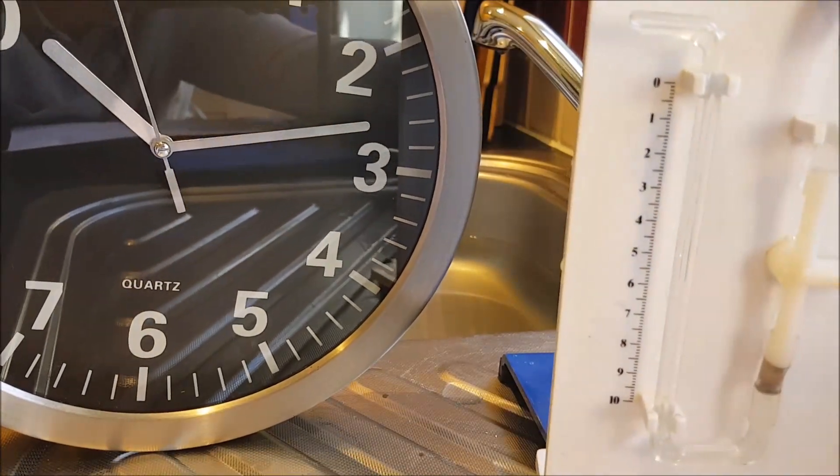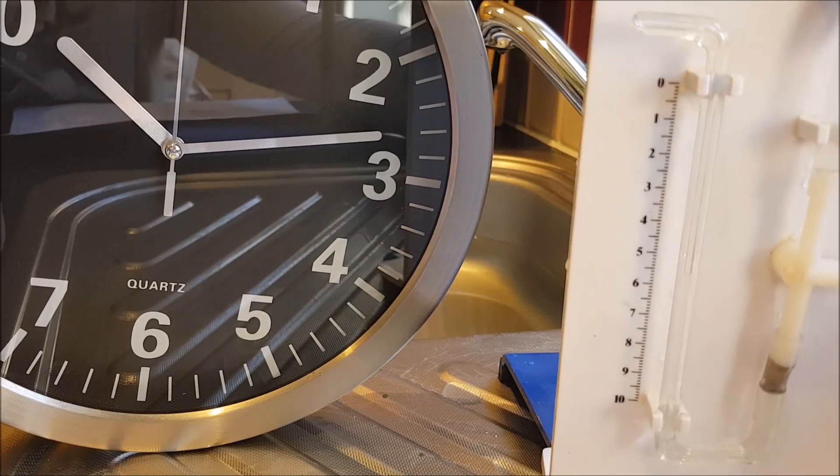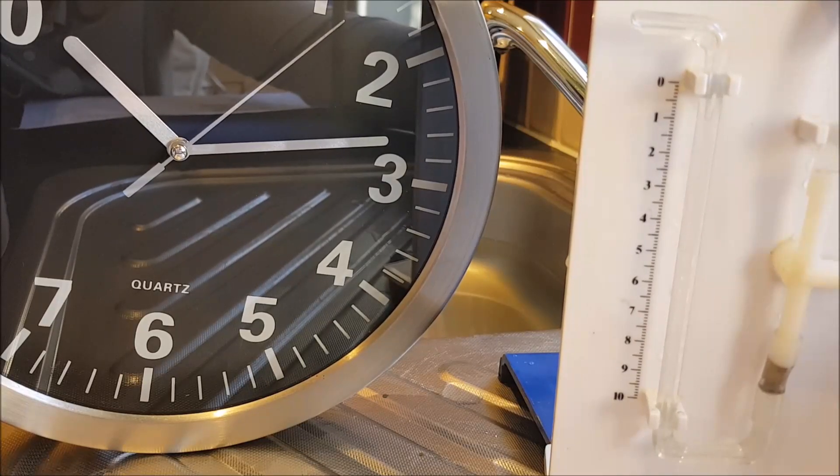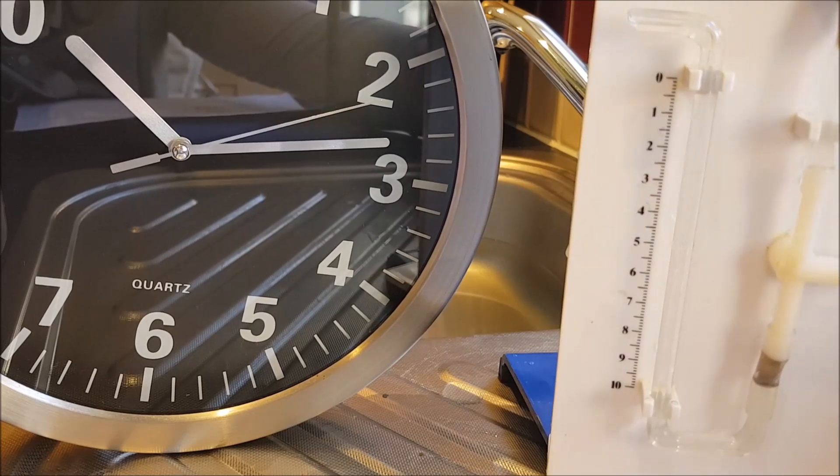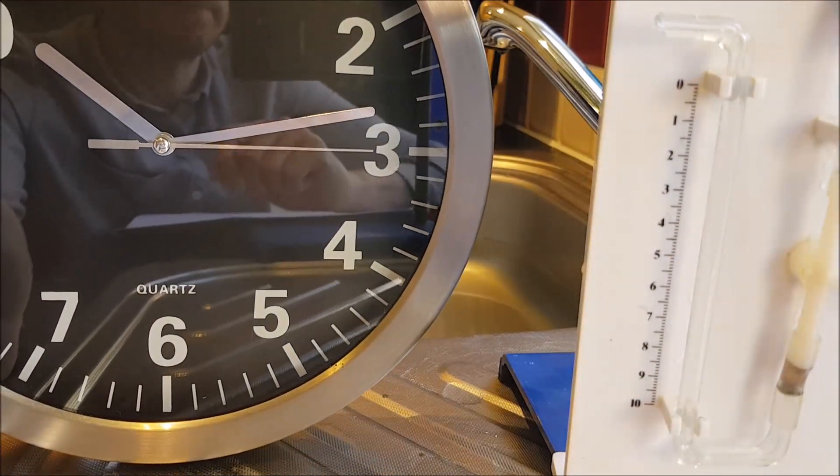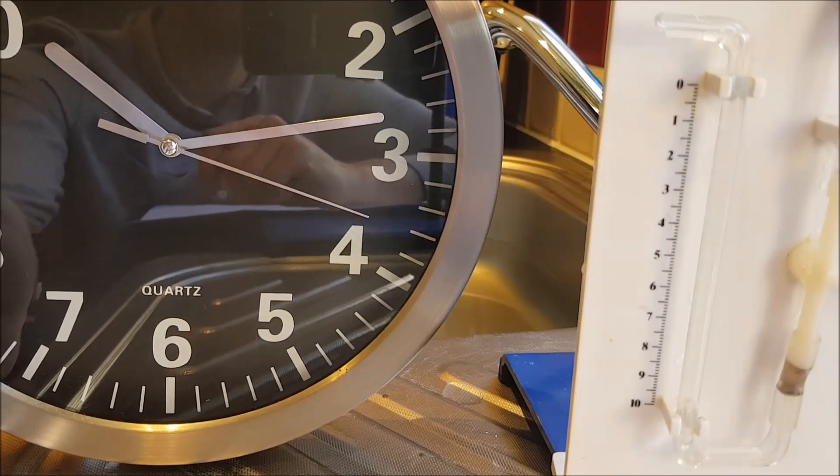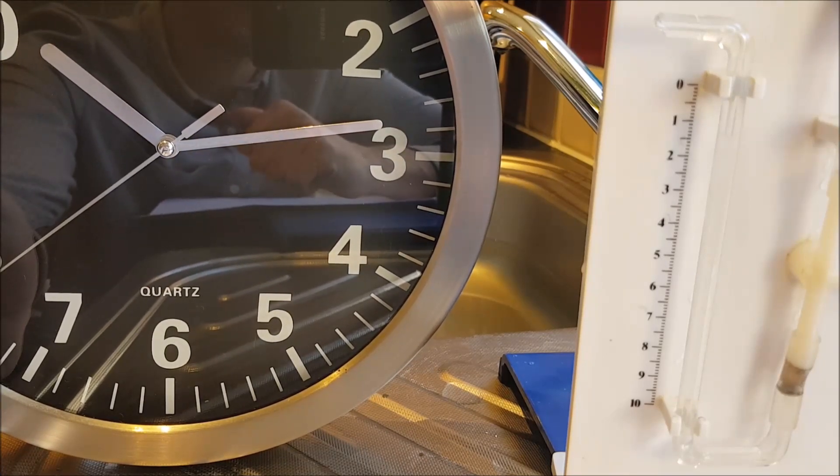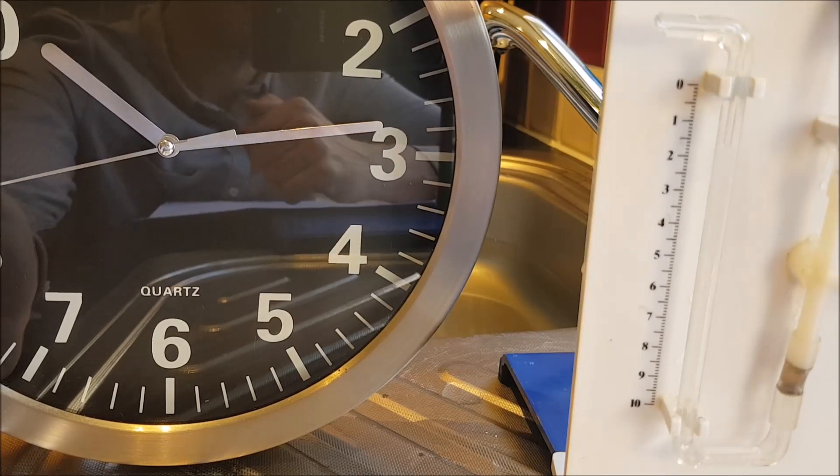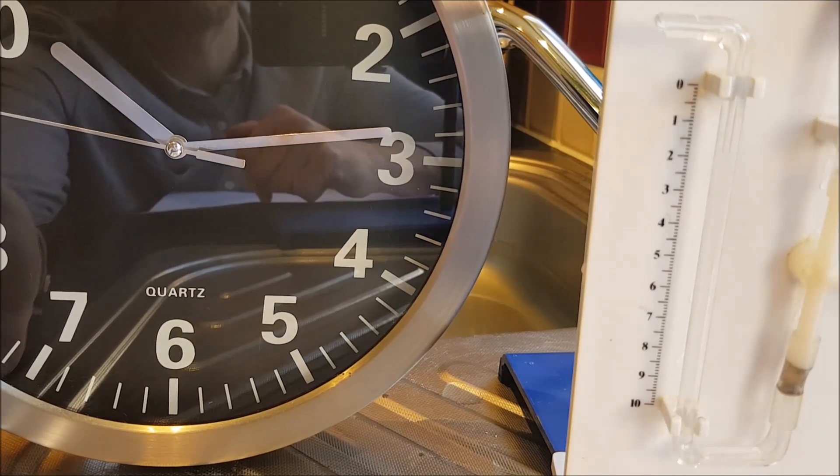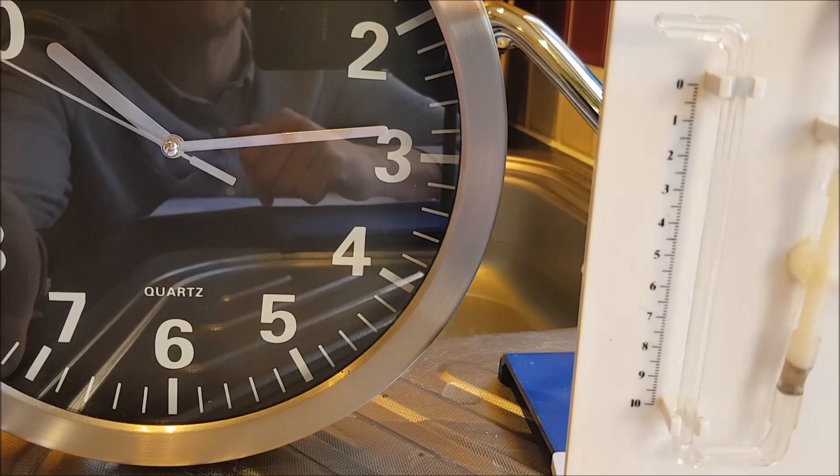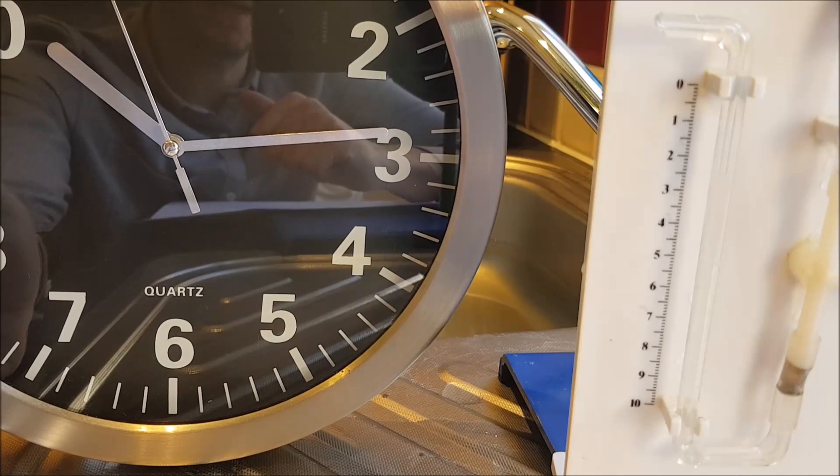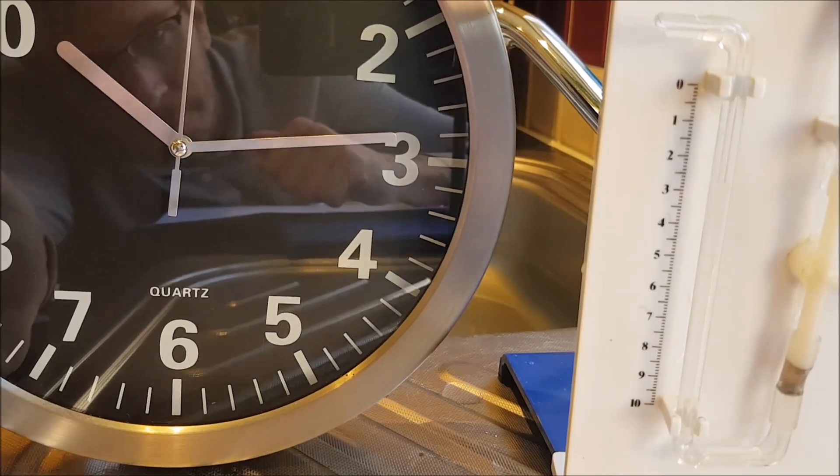I'm just going to push it back up to the top because it's getting near to the end using the syringe. So it's starting at zero at 15 seconds so we can measure for a minute and see how far it moves. Now what you should do is you might leave it to do transpiration or water uptake for maybe five minutes but you'd maybe measure the distance that it moves every minute so that you can see that the rate of uptake is consistent and it's not changing, because if it did change within, if it's different every minute, then you'd know something else was going on at some sort of condition change or you had a problem.